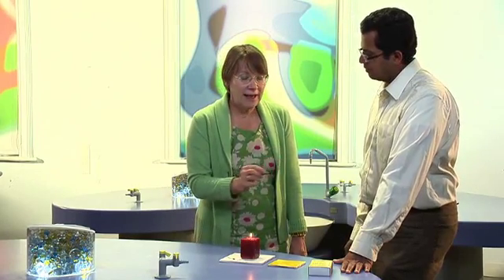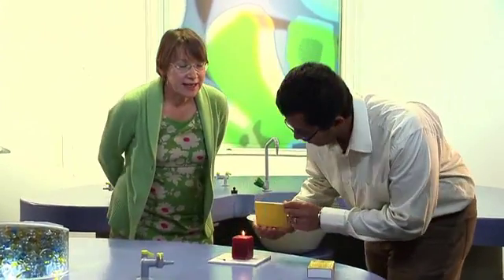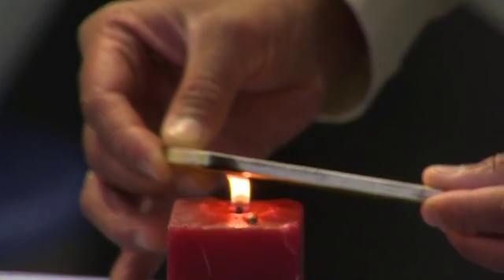Now, if you stop that flame getting enough oxygen, instead of the wax burning to carbon dioxide — a gas — it'll burn to carbon, which is a solid. So what I suggest you do is hold this tile in the flame. Not enough to put the flame out, but enough to stop it getting as much oxygen as it needs to burn. That's beautiful.